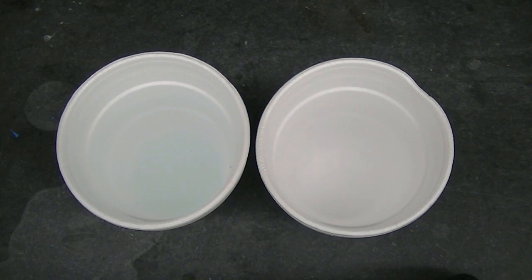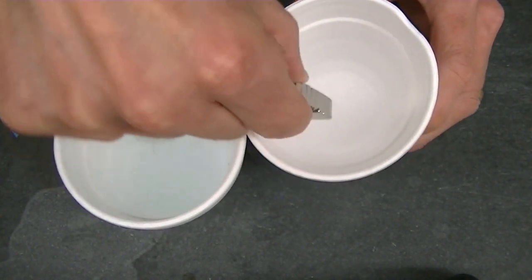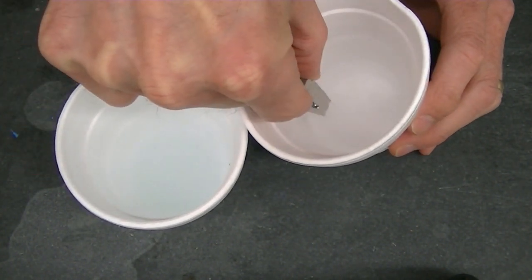Now let's try testing the magnetic properties of both of these liquids. Liquid oxygen is known to be attracted to strong magnets, whereas liquid nitrogen is not. First, let's test the liquid nitrogen. I'll place a strong neodymium magnet into the liquid nitrogen.